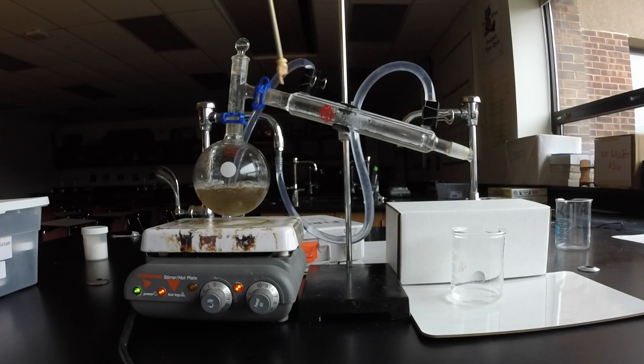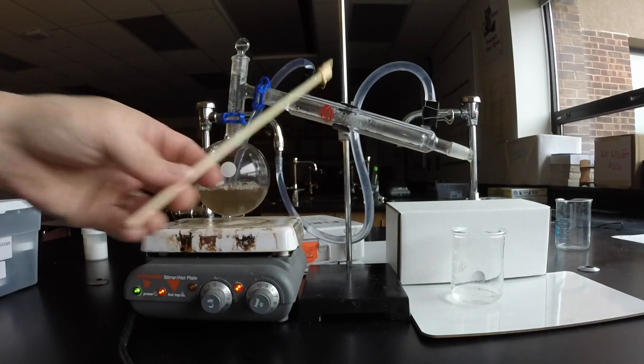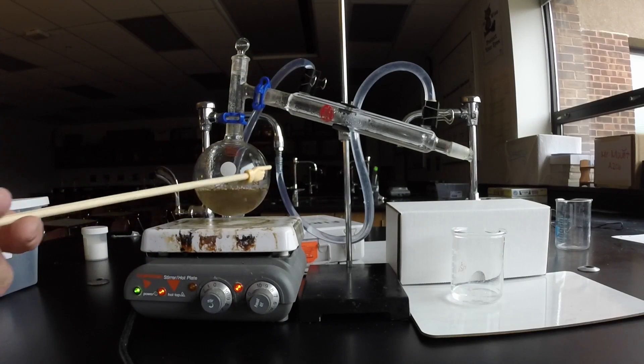Here's where it comes in, and here's where it goes out. That makes the condensing glass nice and cool, probably about 15 degrees Celsius, around 50 degrees Fahrenheit.